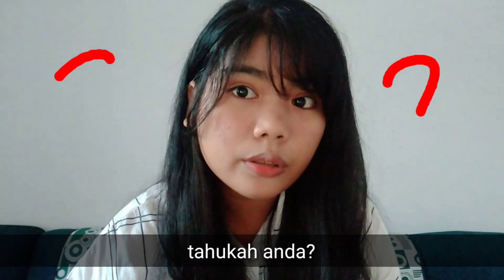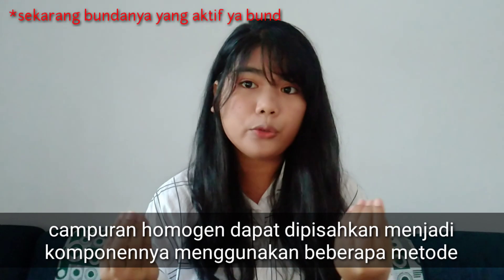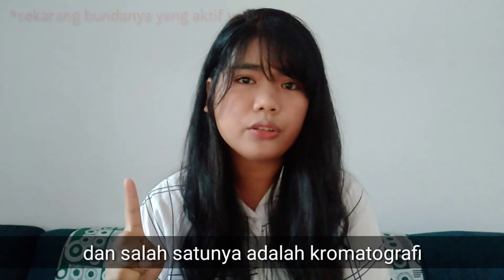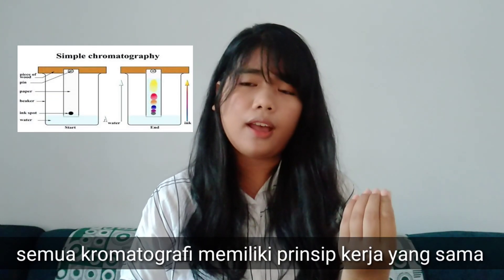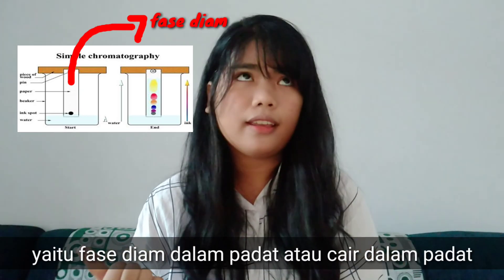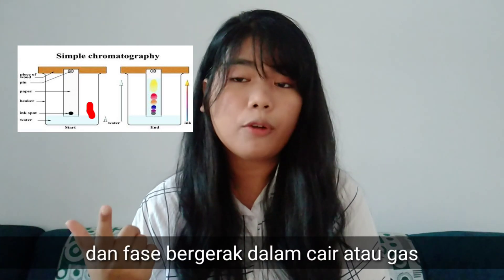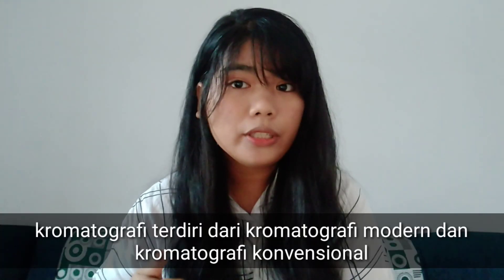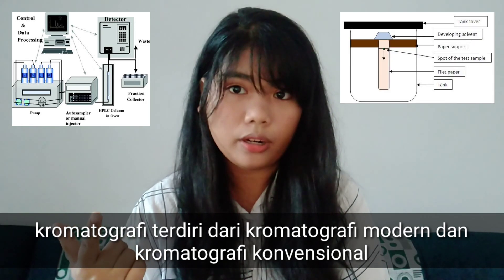Did you know that a homogeneous mixture can be separated into its components using several methods? One of them is chromatography. All forms of chromatography have the same working principle: a stationary phase in solid or liquid placed on solid, and a mobile phase in liquid or gas.